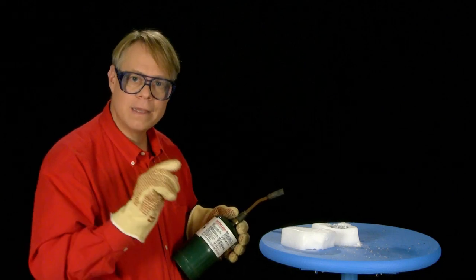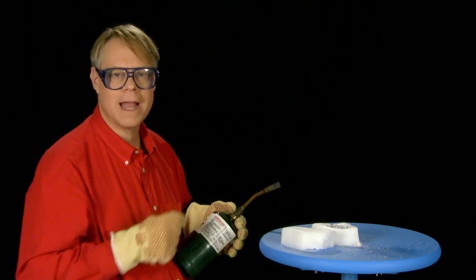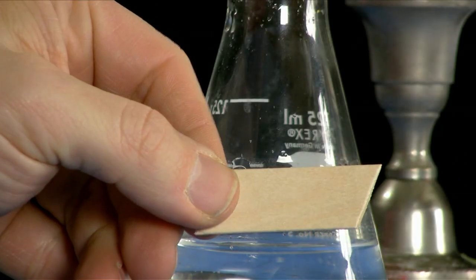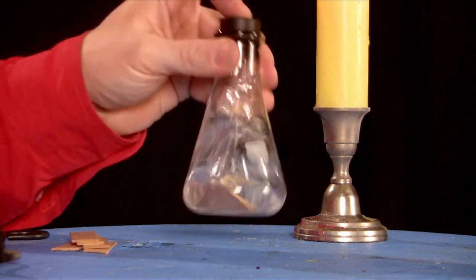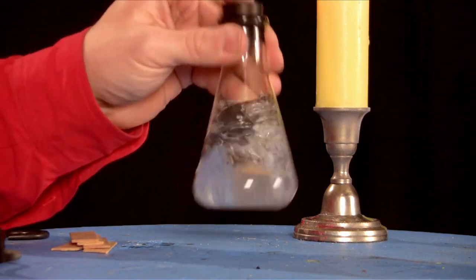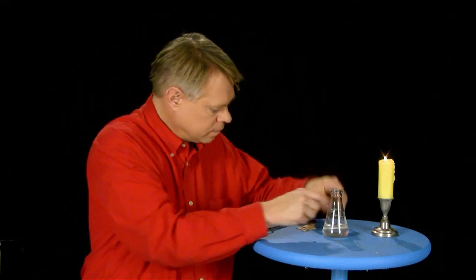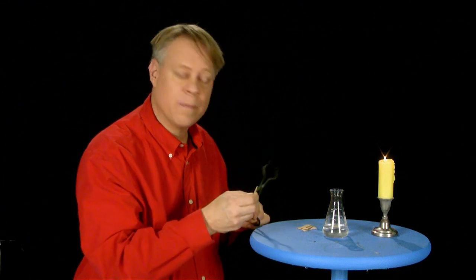And now I may tell you that whenever carbon burns under common circumstances, it produces carbon dioxide. Suppose I take this piece of wood and put it in a bottle with lime water. I might shake that water up with wood in the atmosphere as long as I pleased, it would still remain clear as you see it.